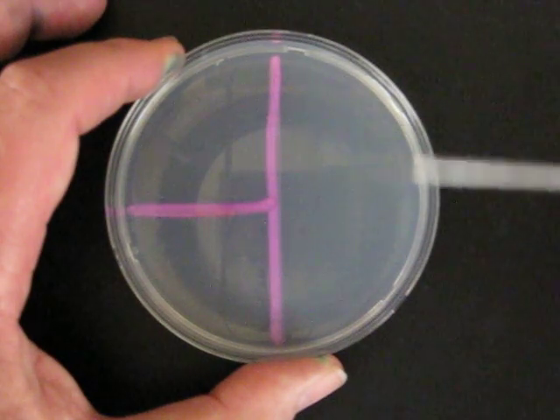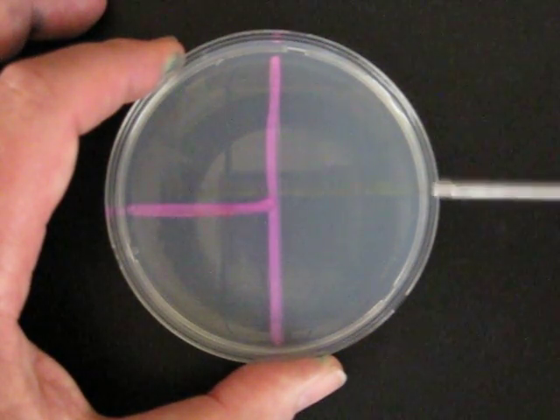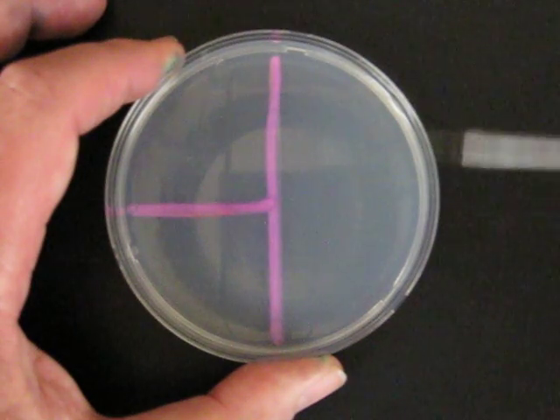Note for each of the three phases, we are always working from the edge of the plate toward the center.